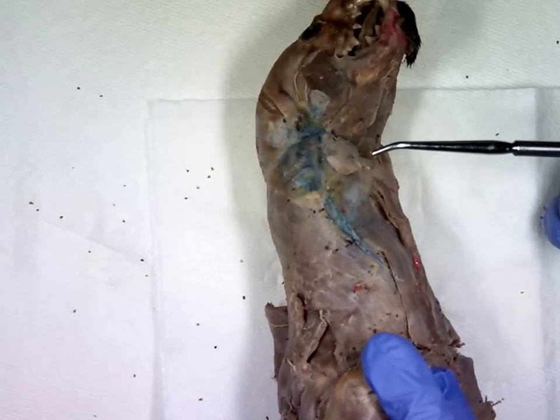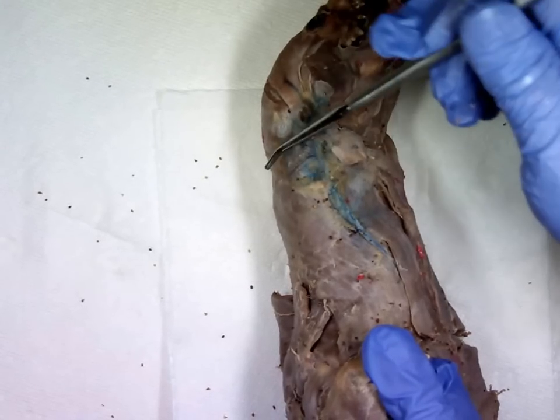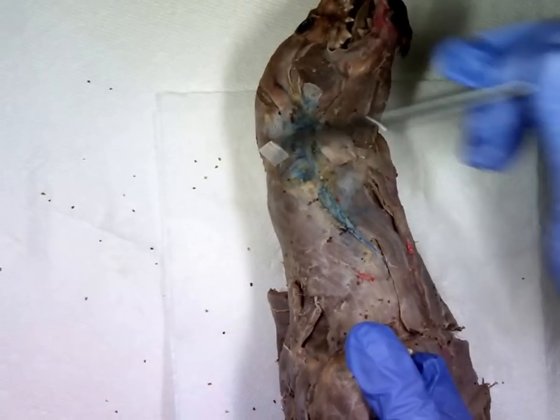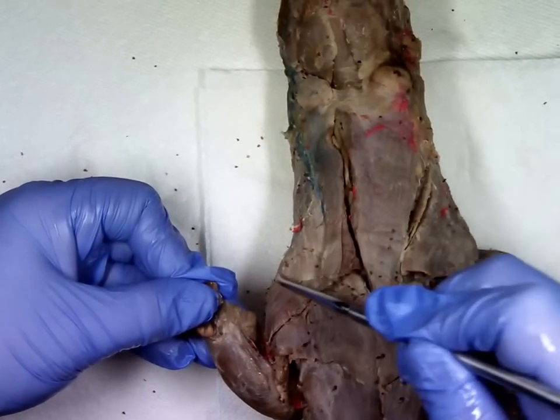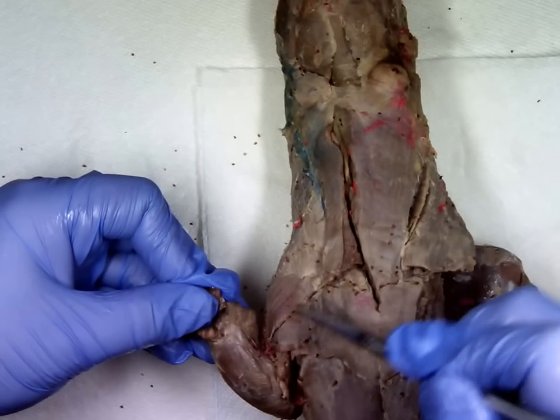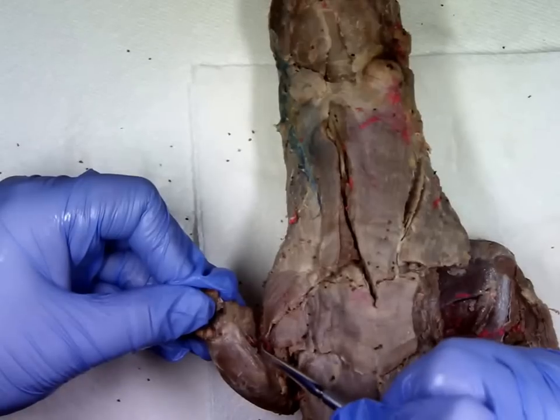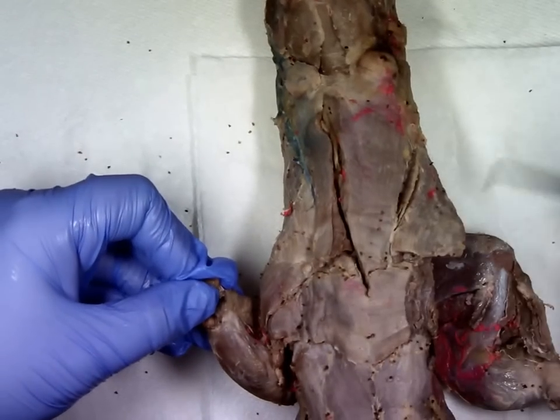While looking at the side of the mink, we can find a rather large muscle that you'll use as a landmark for most other muscle groups. First find your external jugular vein — the muscle directly lateral to it that swings down around to the front is called the clavotrapezius. The clavotrapezius ends at a line here, where a new triangular muscle begins called the clavodeltoid. The clavodeltoid originates at the clavicle and inserts onto the humerus.